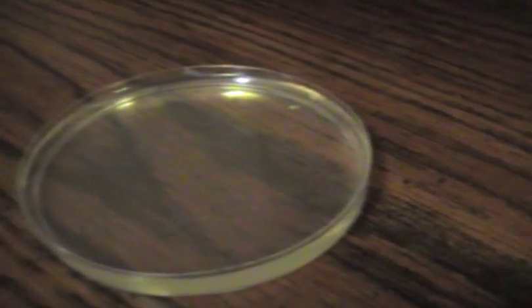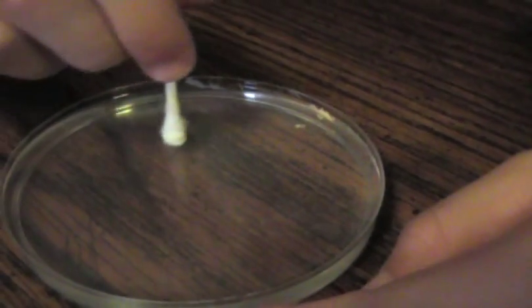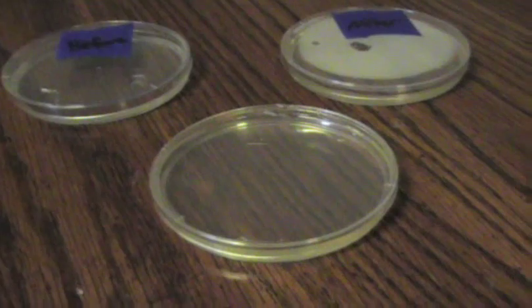Alright. That's good. And then very gently. Look what happened. Okay, we've got the sample from the door. We're going to put a lid on it and set that aside and label it.